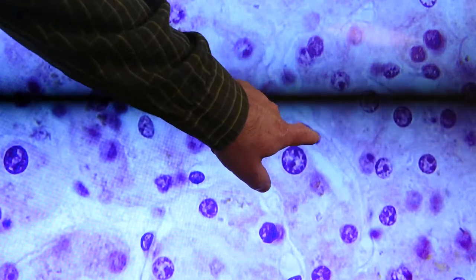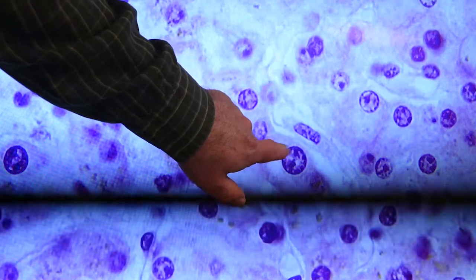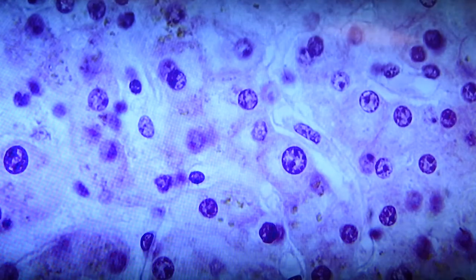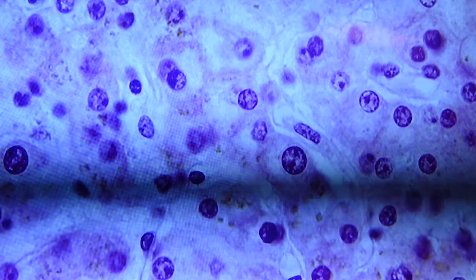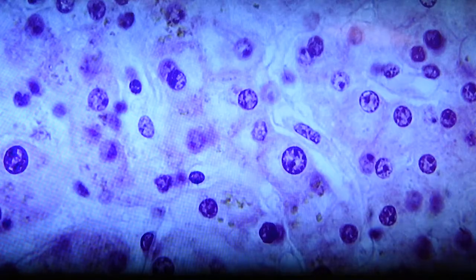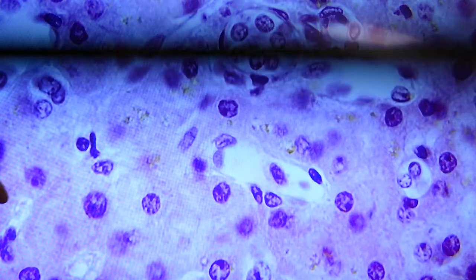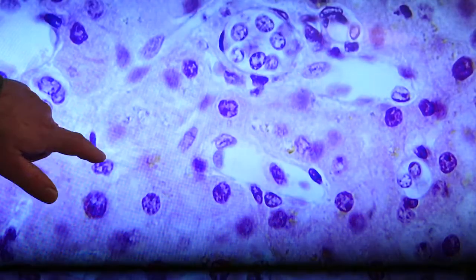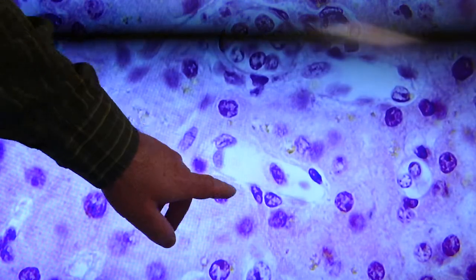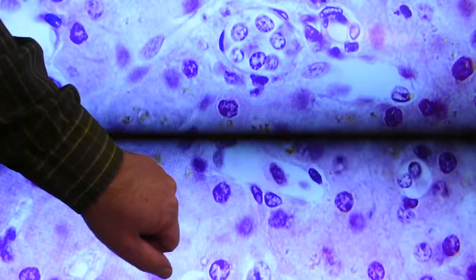This one also labeled for Kupffer cell. This one is a Kupffer cell right here in this picture, and you can see the endothelial lining, the space of Disse, and the hepatocyte. Here's another, this is a sinusoid, this is a sinusoid. There's a tiny little sinusoidal space there. Anyhow, endothelial nucleus here associated with that sinusoid, and in the middle here is a Kupffer cell.